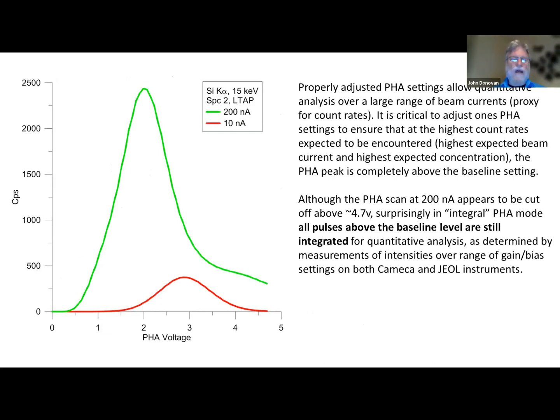It just causes problems. Correct for it quantitatively in the software. And in the PHA, in terms of the hardware alignment, you want to make sure that because of pulse height depression, so here we've got a 10 nanoamp on, I can't remember what material this is, maybe SiO2. And then this is at 200 nanoamps, and it does shift down a little bit. What we wanted to make sure is that we do not cut off any characteristic X-rays at the baseline voltage.